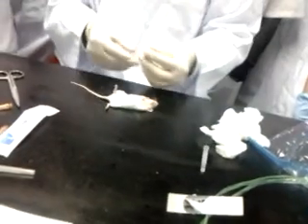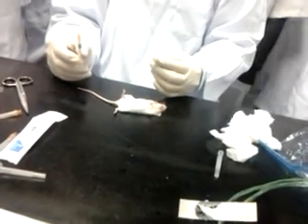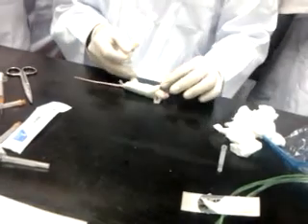What gauge of needle can we use? Use a smaller gauge. A 25 gauge needle should be okay. When you do cardiac puncture, the mouse is about 25 gram or 22 gram. Blood is about 6% of 22 gram, so about 1.2 to 1.5 mL. Take about one third of 1.5. How much? 0.3 mL? Should be okay. I take only 0.3.